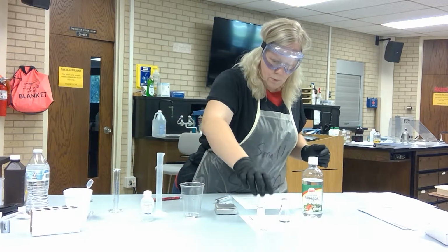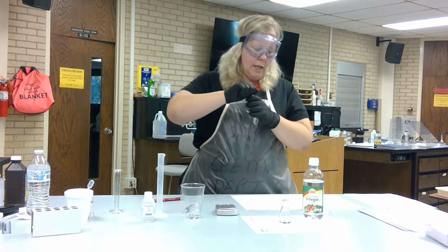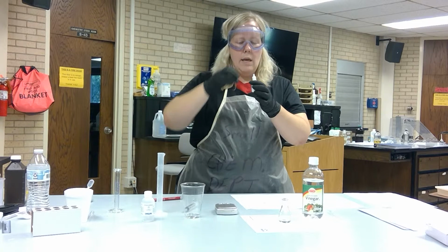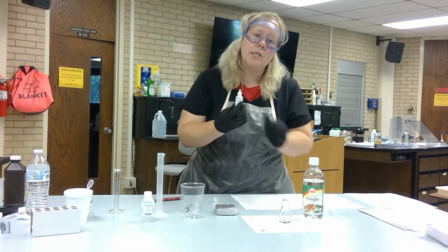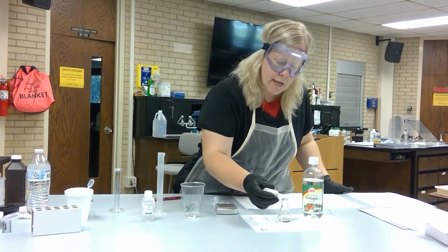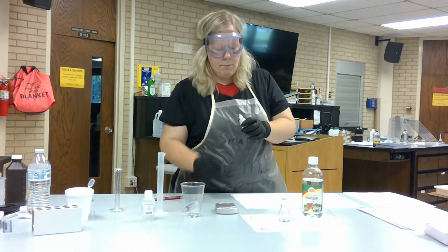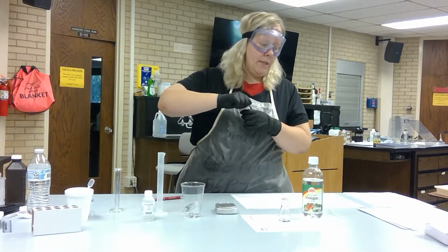All right, before I move on to dealing with sodium hydroxide, you're going to need to take your phenolphthalein indicator. This is your acid base indicator, so at certain pHs it will change colors. So I'm just going to add a couple drops. It doesn't take a lot, but this is what's going to signify the end of the reaction.